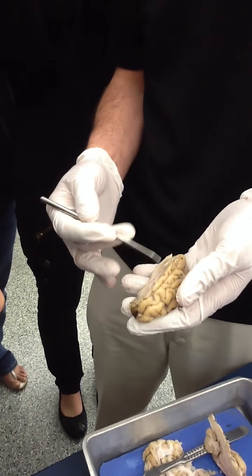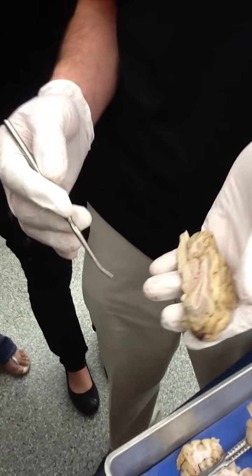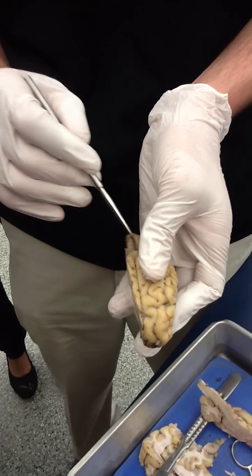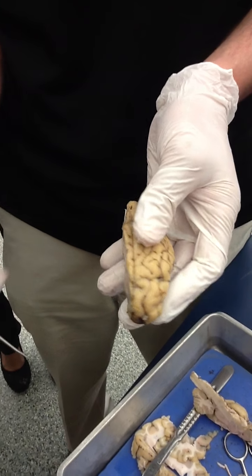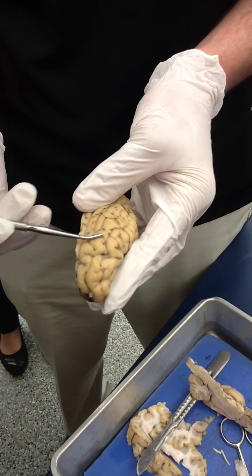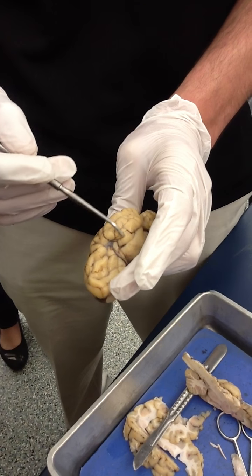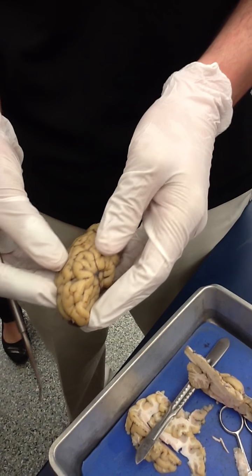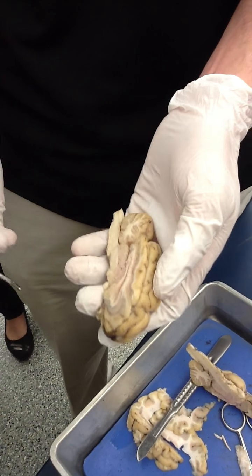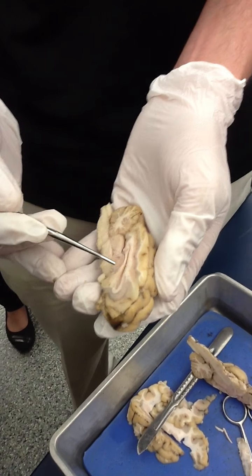We've already done a lot of the preliminary work: identified our external structures — hemispheres, longitudinal fissure, transverse fissure — and identified the lobes: frontal lobe, parietal lobe, occipital lobe, temporal lobe. We've gone ahead and done a sagittal section, and we can begin to identify some structures here.